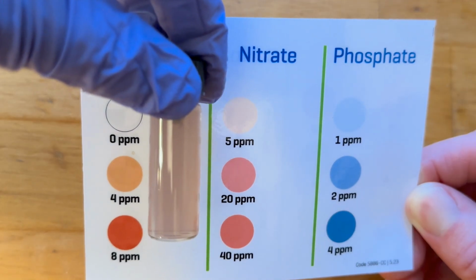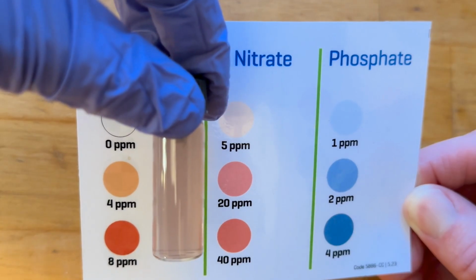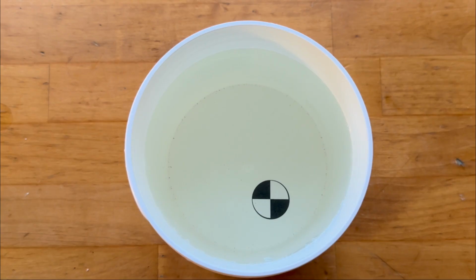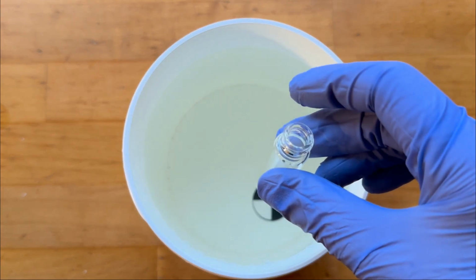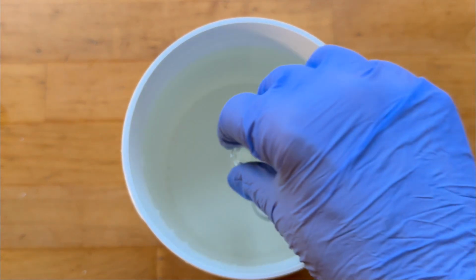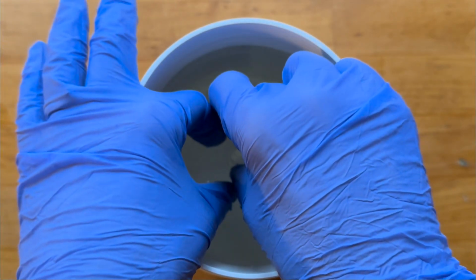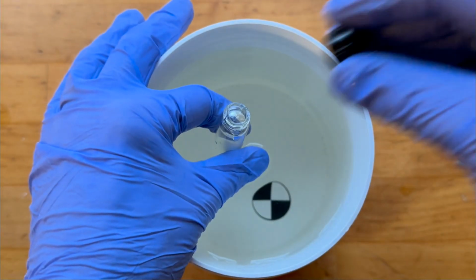So after 5 minutes, I'm checking the dissolved oxygen, and it looks like probably it's most closely resembling the number of the 4 ppm. So the next test that you will be doing is the biochemical oxygen demand, and it has a similar start as the dissolved oxygen test, where you're submerging your tube into the water, and what you really want to do is make sure that you've got it completely submerged so that it goes up to the top, and then you add the cap.